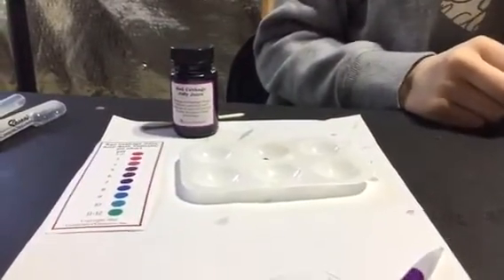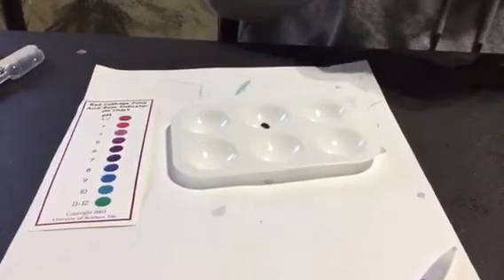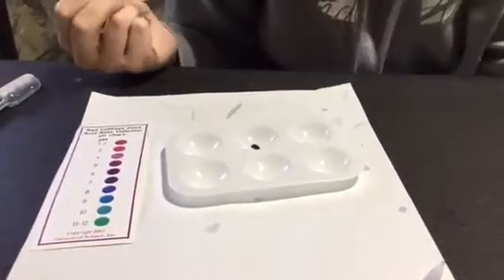If you have the cabbage powder, would you put that powder right there in the shot? That Jiffy cabbage powder - you may have some generic. The directions call for putting one scoop, one of these little scoops, in 50 milliliters of water. That is not going to work. We're trying to do a drop method for titration. So what we ended up doing is we put in a tiny bit of the powder - I mean a tiny bit. The only time it worked pretty well was just with a fraction of that little tiny scoop, which I have no idea what volume that is.